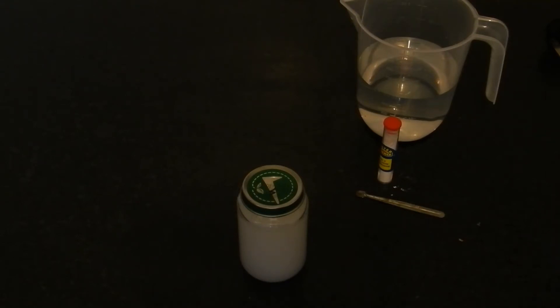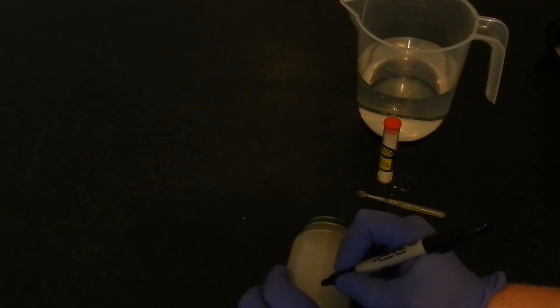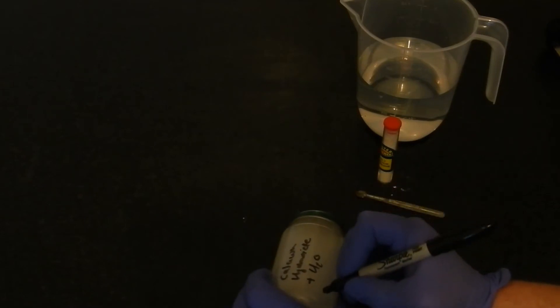Because otherwise you will have no idea what is inside it. So what we're going to do is we're going to write on here calcium hydroxide plus water, 29th of March 2020.